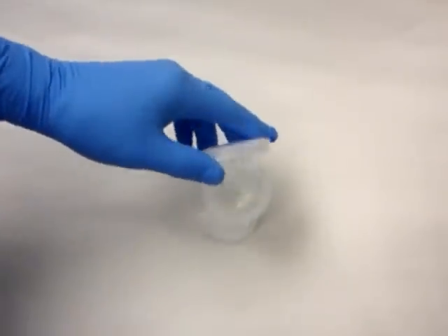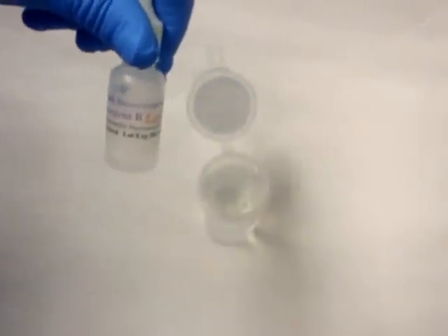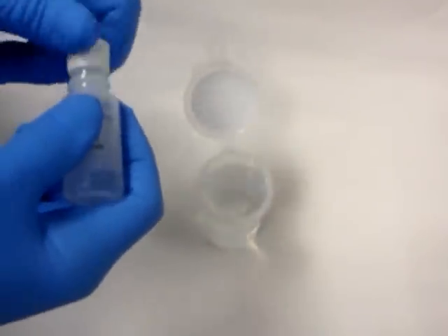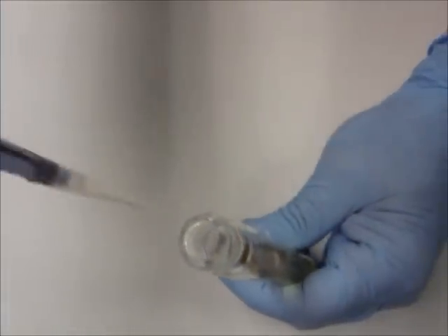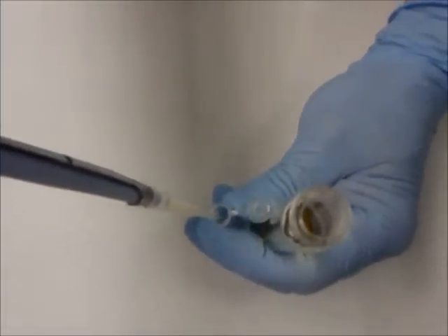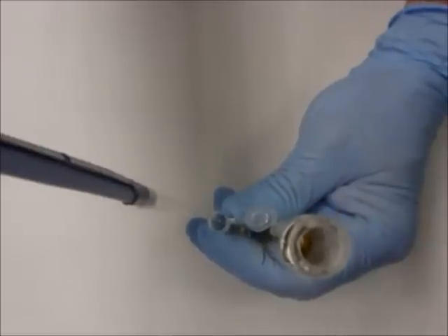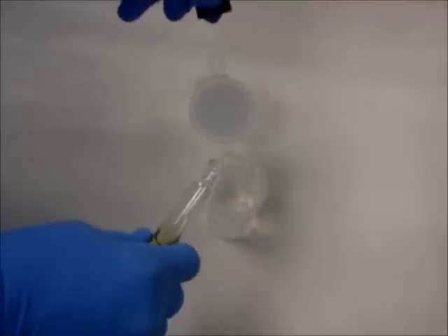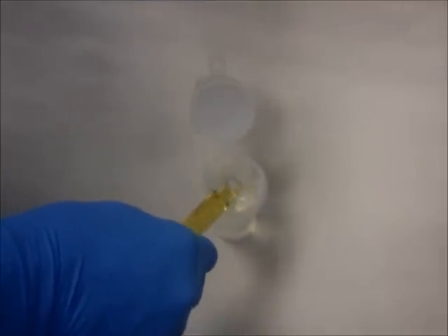For this demonstration, we will be using a liquid sample. First, collect your 100ml sample and add 4 drops of Reagent B, the enzyme inducer.